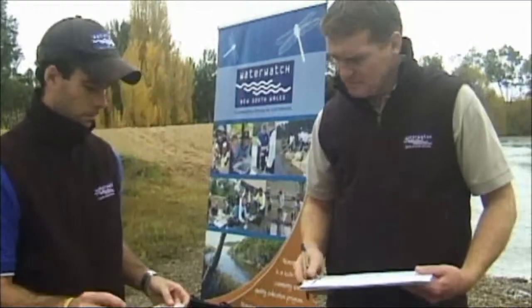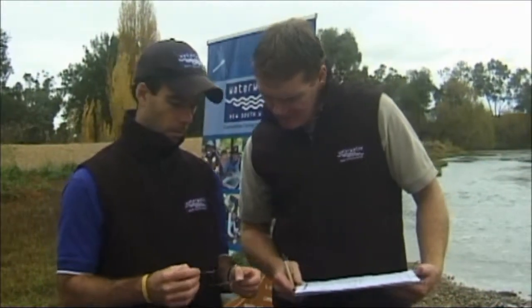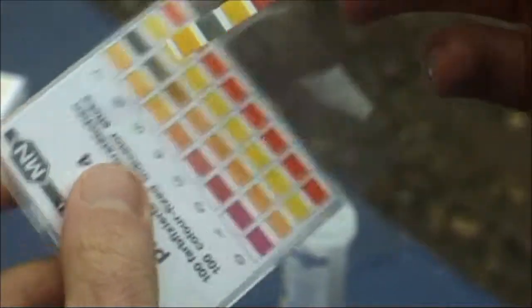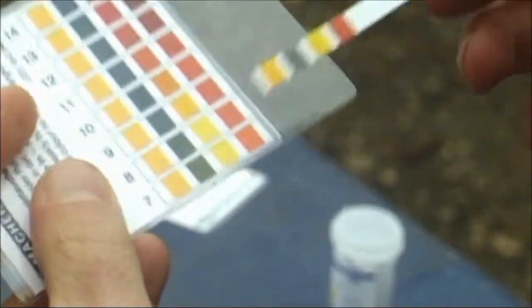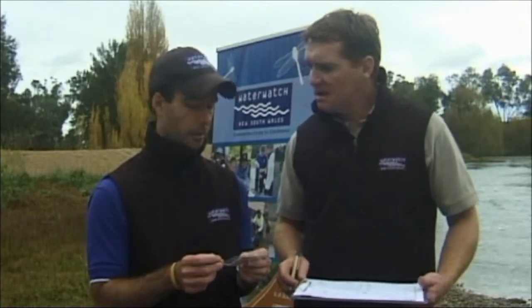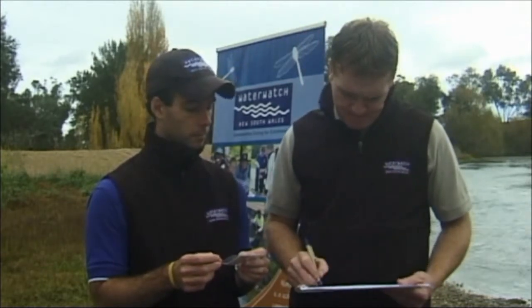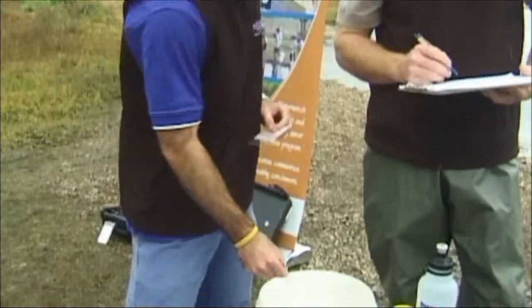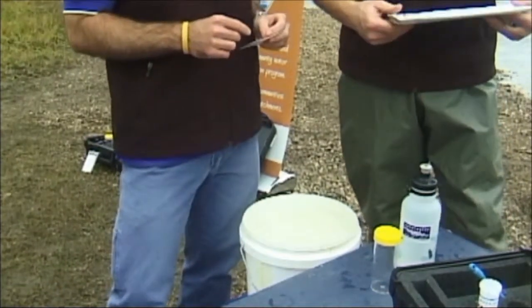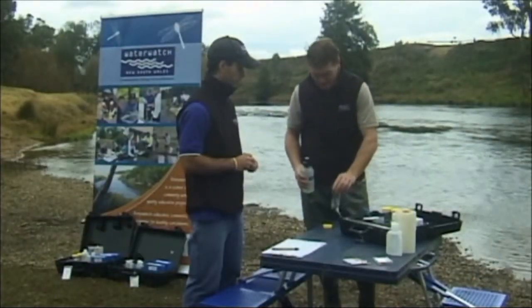Take the strip out of the water and match the colours of the strip to the colour chart. You may estimate between colours if you cannot find an exact match. Record your result, dispose of the pH strip in a bin, and rinse your container.